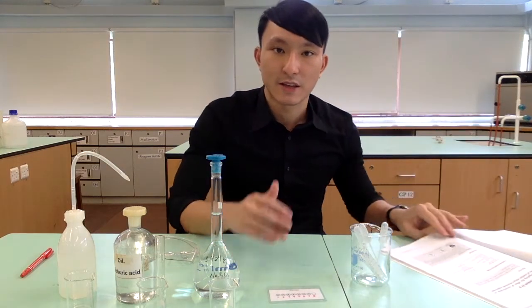Hi, in this video I'm going to show you experiment 37.2 to investigate the effect of concentration on the rate of reaction using a microscale experiment. In this experiment we will be using the reaction between sodium thiosulfate solution and dilute sulfuric acid.